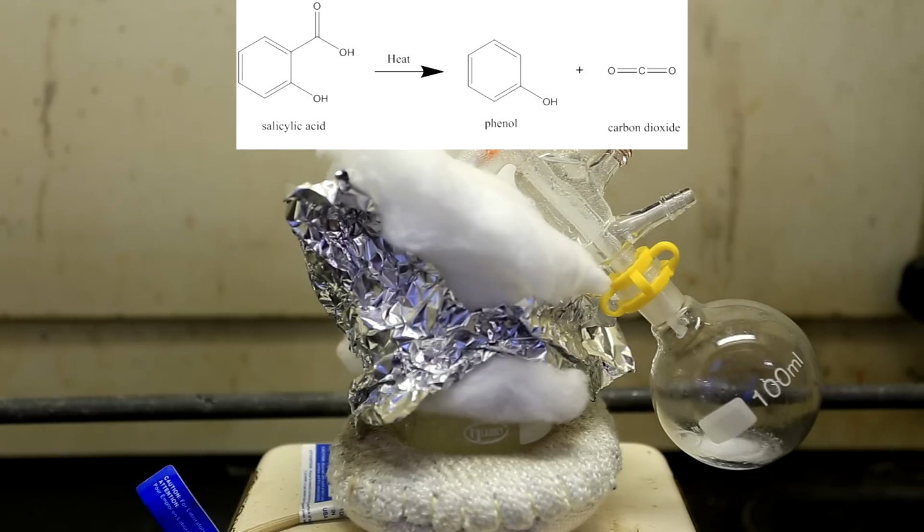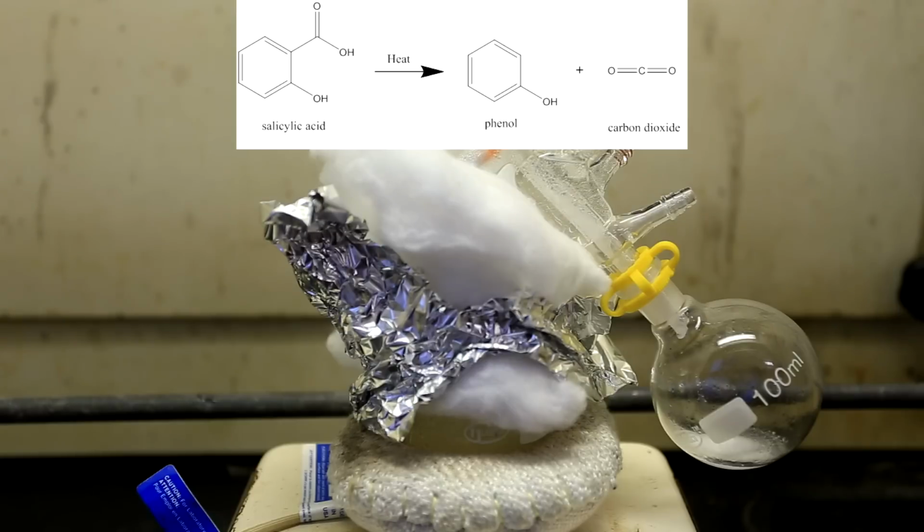The reaction that is occurring is shown above. The reaction is quite simple, where salicylic acid is decarboxylated by heat to produce phenol and carbon dioxide. The phenol has a much lower boiling point than the salicylic acid, so it's distilled off.